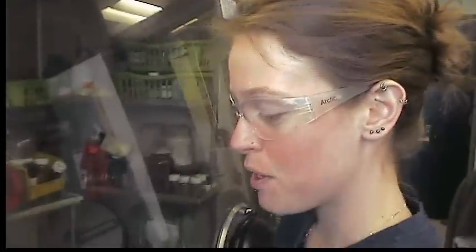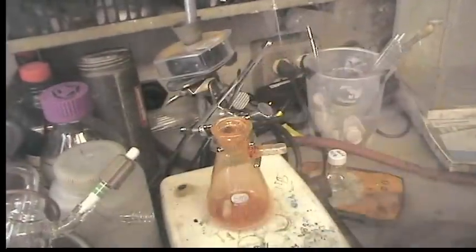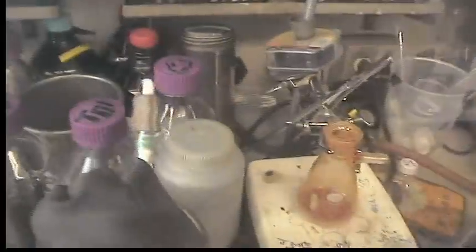With the ASP3 synthesis, the reaction mixture is pretty dry. It looks just like a bright orange powder. So we're just going to get it out of this reaction flask and then put it into a sublimator. And the sublimator we're going to use has a very flat bottom and that's where all the ASP3 will collect. It has a very narrow body so the ASP3 doesn't sublime all over the top of the vessel.